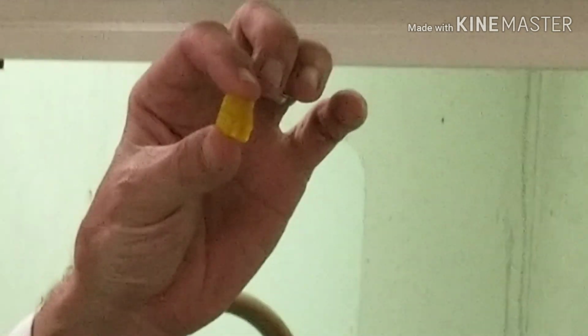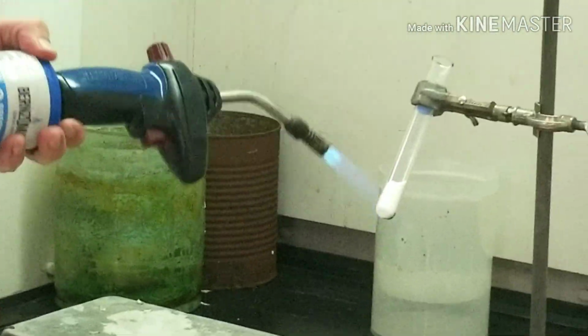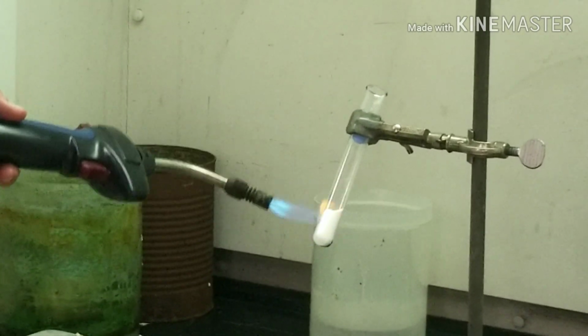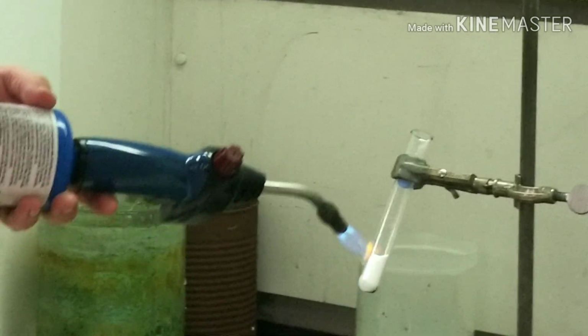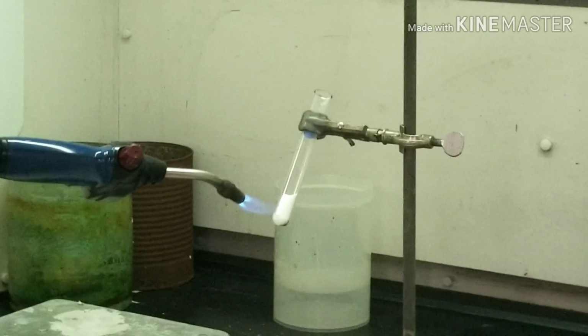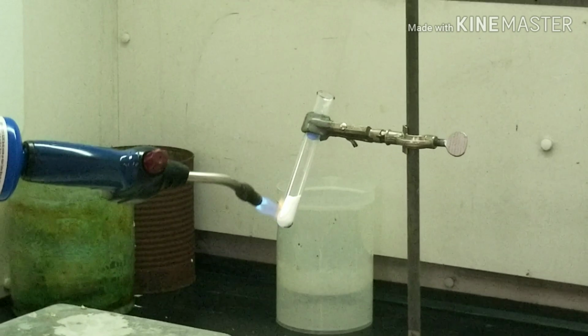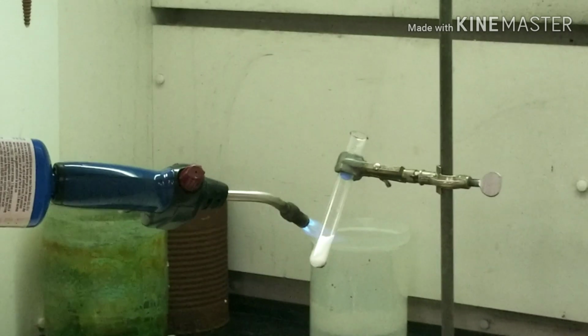Here is my gummy bear that I'm going to use. I was told by my son Ethan that I should use yellow because yellow is his least favorite and he wants to eat the rest of them. So we're going to sacrifice the yellow gummy bear. It's starting to turn to a liquid here, not all of it, but we want it to turn to a liquid. At that point, we know that the decomposition reaction is underway. Then I will take the gummy bear and put it in the test tube. Sometimes it gets stuck a little bit, so I will have to push it down with a glass stir rod.